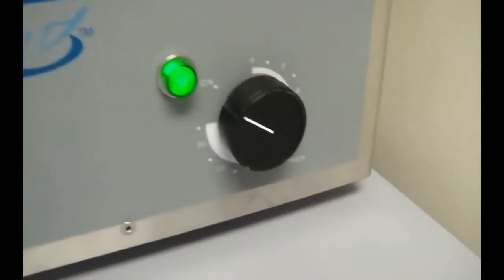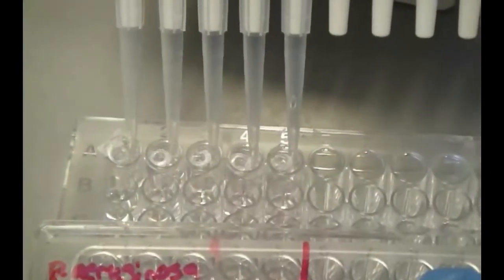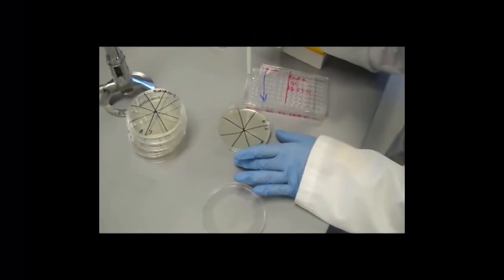The plate is sonicated for 30 minutes to recover the attached biomass and the cell density is confirmed by serially diluting and spot plating.